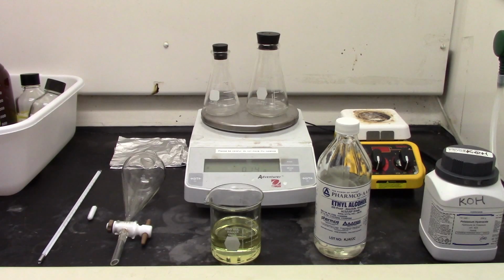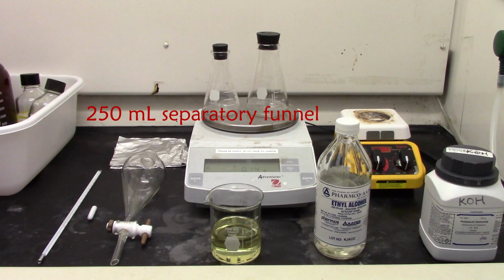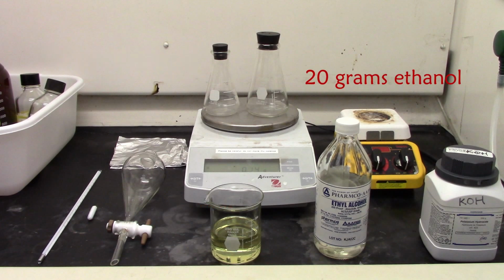In this laboratory exercise, we will be making a small batch of biodiesel. To conduct the exercise, you will need a 125 milliliter and a 250 milliliter flask, all with stoppers, a 250 milliliter separatory funnel, a stirring hot plate and magnetic stir bar, thermometer, aluminum foil, and a weighing scale. For reagents, you will need 100 grams of vegetable oil, 20 grams of 100% ethanol, that is anhydrous, and 1 gram of potassium hydroxide for the catalyst. You will also need to prepare the data tables as shown here.